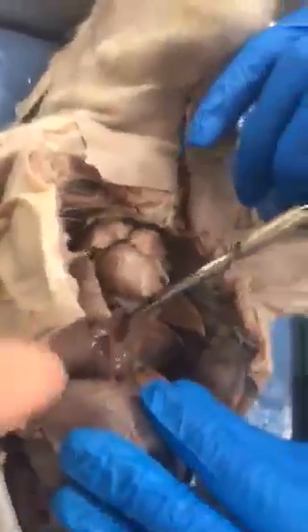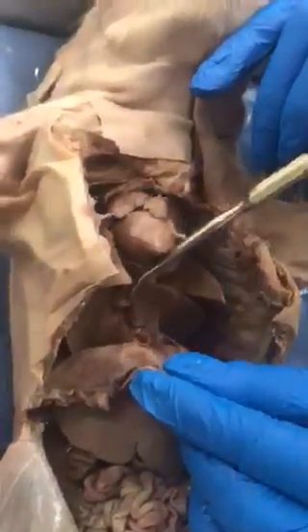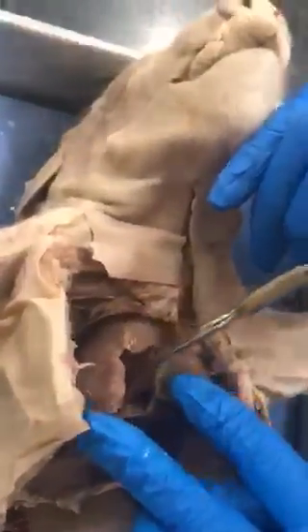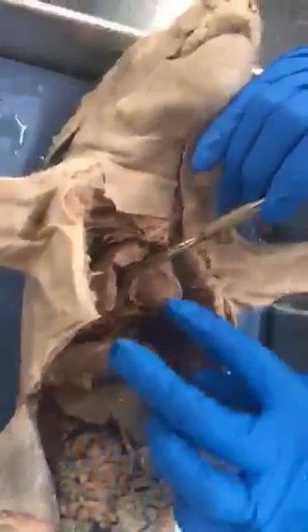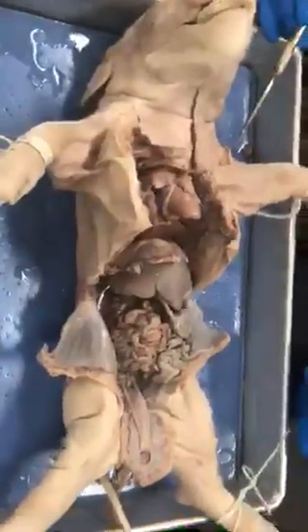And then I just had a question. From the bottom of, I think it was the liver, going, maybe underneath the inferior vena cava. Yeah, that's the entrance into the, what's that hole? And then the other one's right there. Right there. Yeah, that looks like inferior vena cava. Okay. Yep, because it seems to be going right up into the bottom of the right atrium, which is where that goes. Okay. Cool. Alrighty.